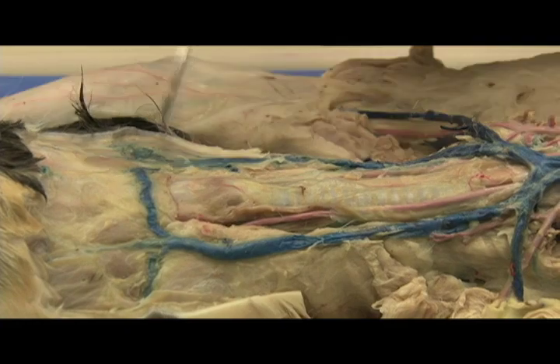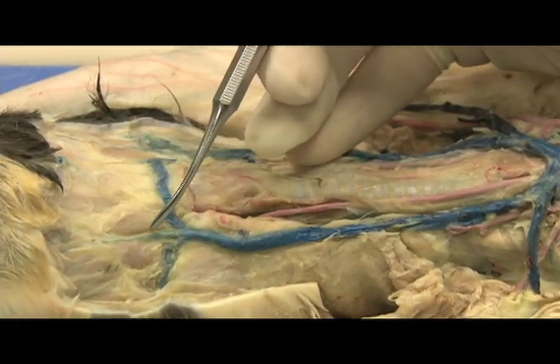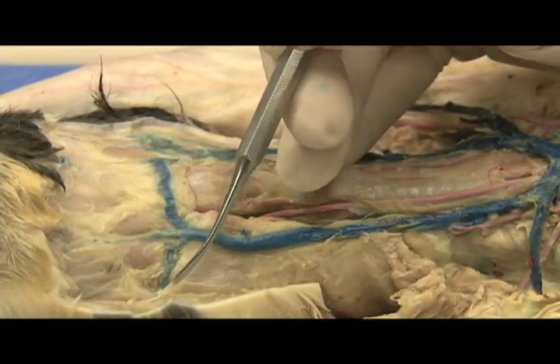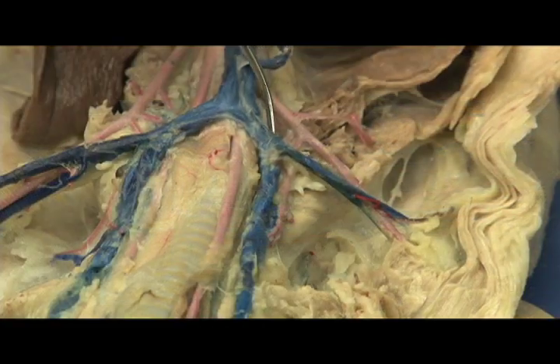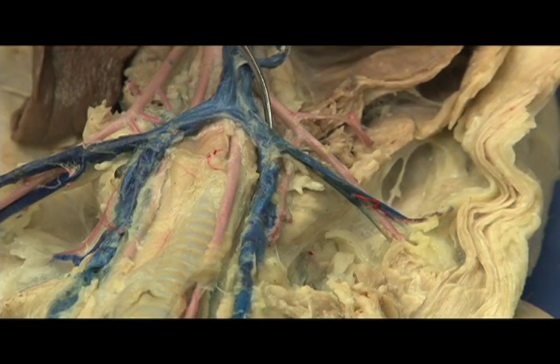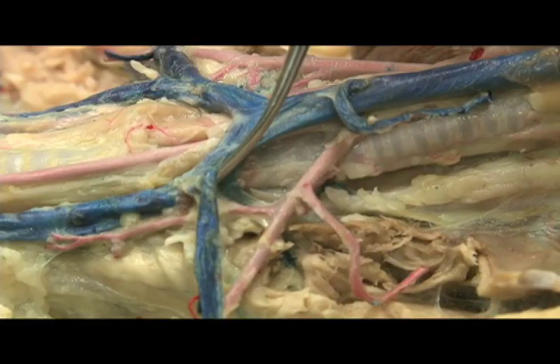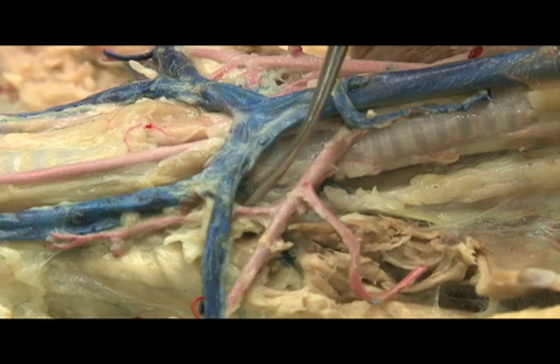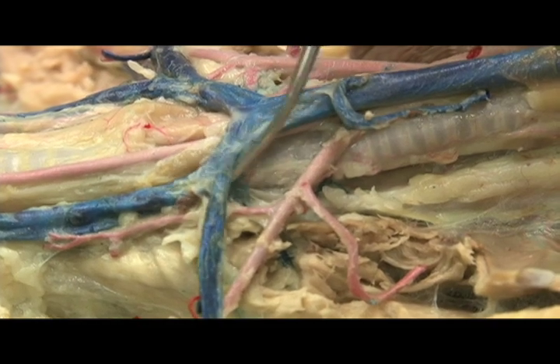This is the anterior facial vein, and this is the posterior facial vein. Draining blood from the deep neck and into the brachiocephalic vein is the vertebral vein.